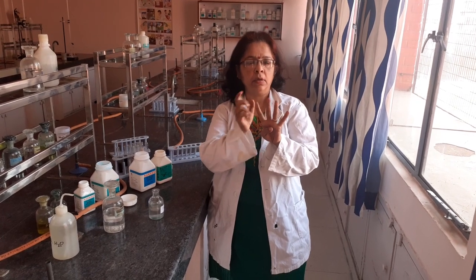Very good morning students. In today's class, I will be talking about the cation test for Group 4. Group 4 of salt analysis has got 4 cations: Cobalt, Nickel, Zinc, and Manganese.